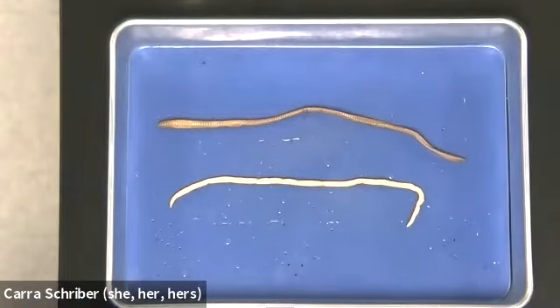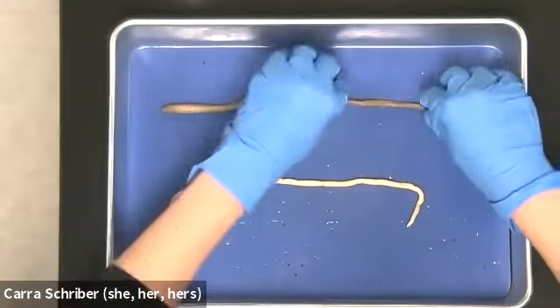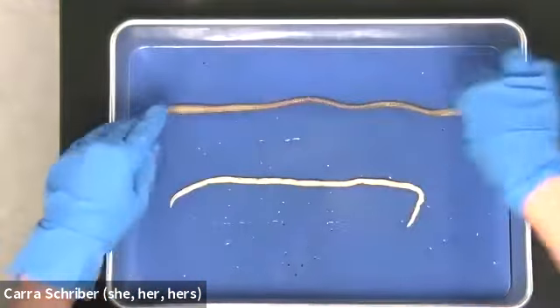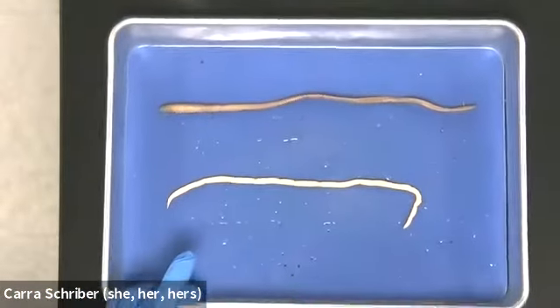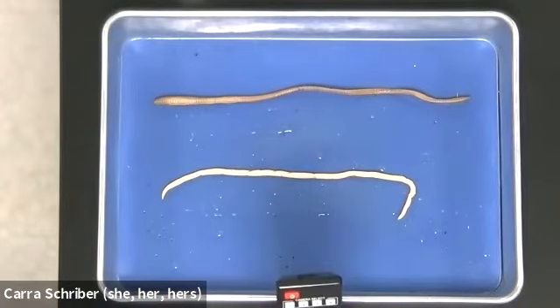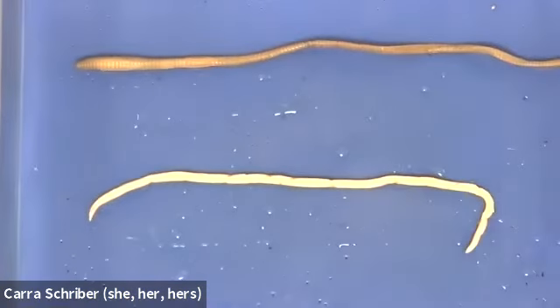So the first thing we need to do with any dissection is orient our organism in a way that we're working from the head down to the tail. With these 2 different worms, that can be kind of complex because worms have a little bit less differentiation on the outside of their bodies. But let's see if we can figure it out here.